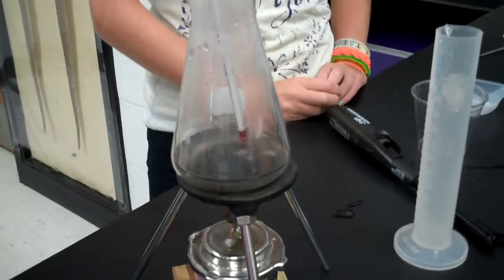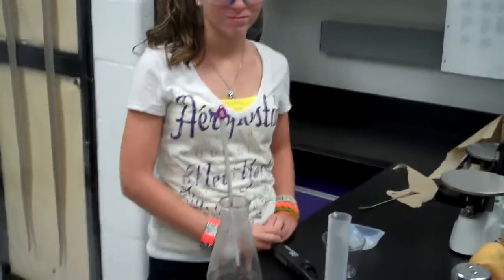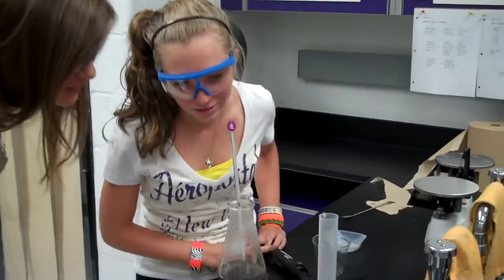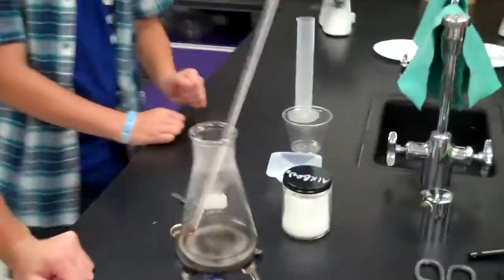Actual boiling liquid. Excellent. What's your temperature, ladies? It's 55. Okay, you're getting close. Alright, looking good. Monitor the temperature.